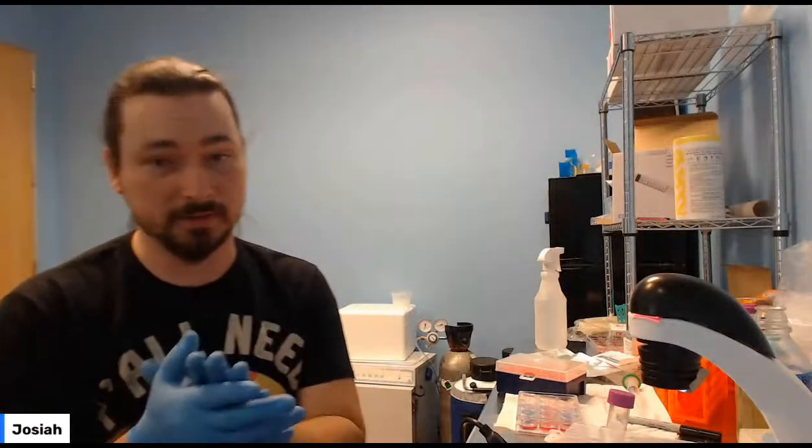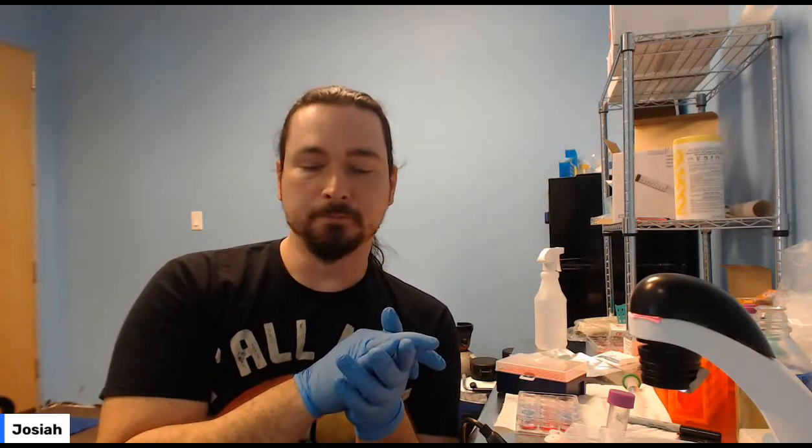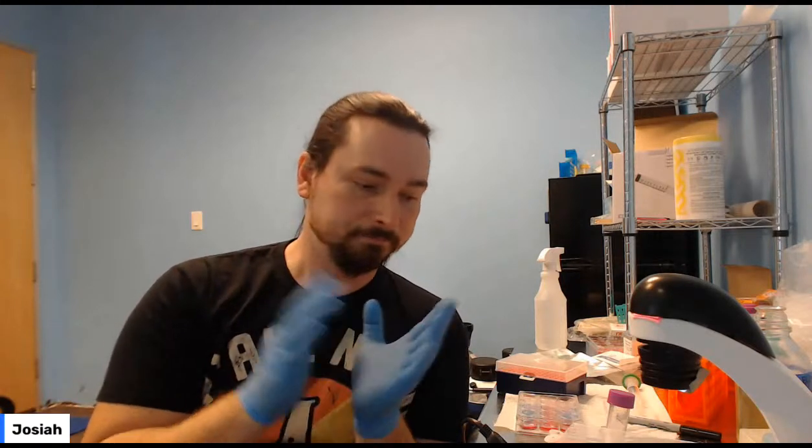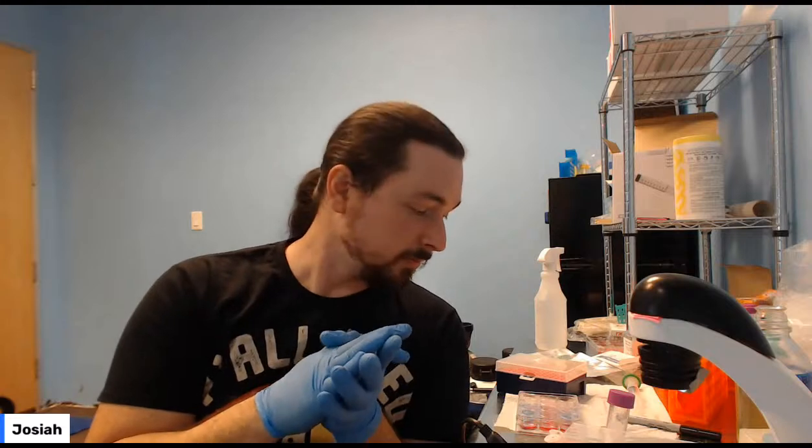Okay, so beta-galactosidase breaks down a sugar called galactose, and what we're using for the last step is something called X-gal, which is like a modified galactose. Normally galactose is involved in digesting lactose because galactose is part of lactose. Take a galactose and a glucose and stick them together, you make a lactose, which is a milk sugar. You break that down with lactase, and then beta-galactosidase breaks down the galactose. But none of that really matters for what we're doing because we're not actually trying to digest the sugar. I mean, we kind of are.